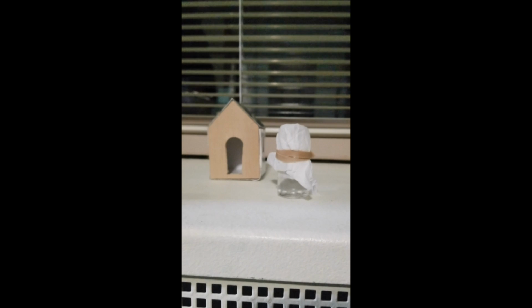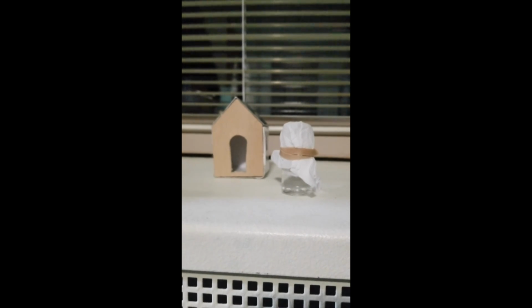The lack of crystal growth can be due to the placement of the vial. Currently it resides on the radiator. The added heat may have caused the solubility to change for this molecular solid because as temperature increases, so does the solubility constant. For example, we originally used 25 degrees Celsius or 77 degrees Fahrenheit and a solubility constant of 1.41 grams per 10 milliliter water for our calculations.